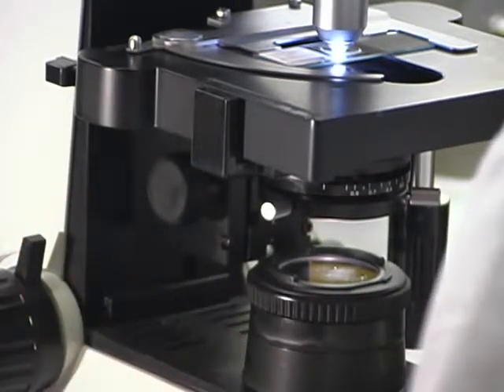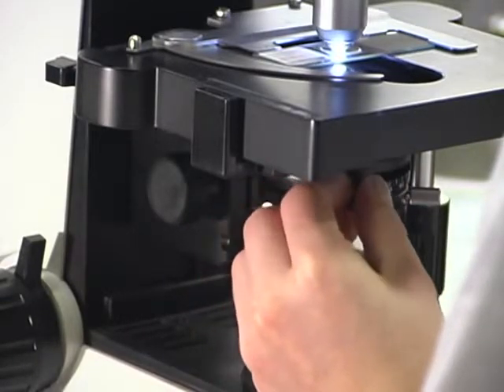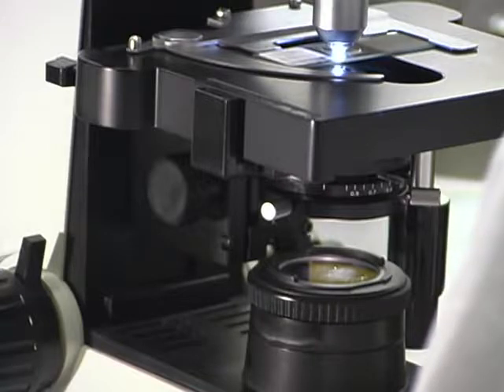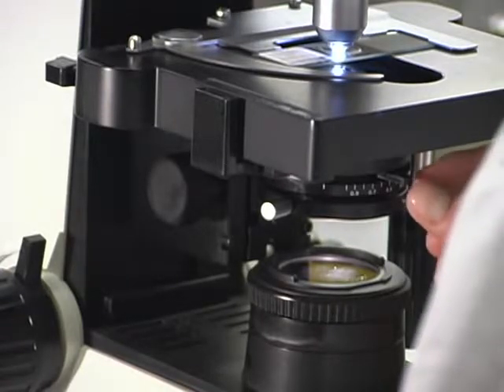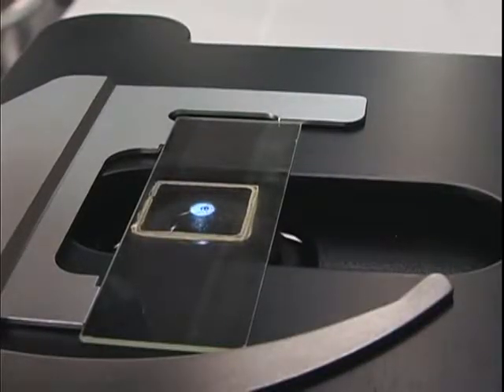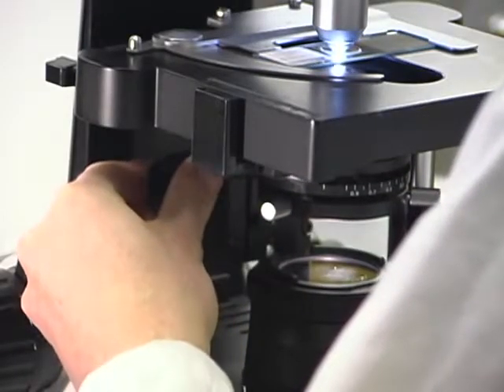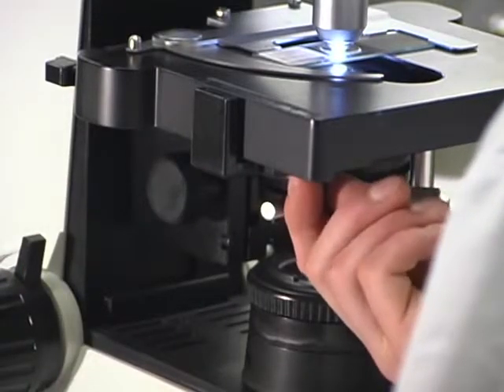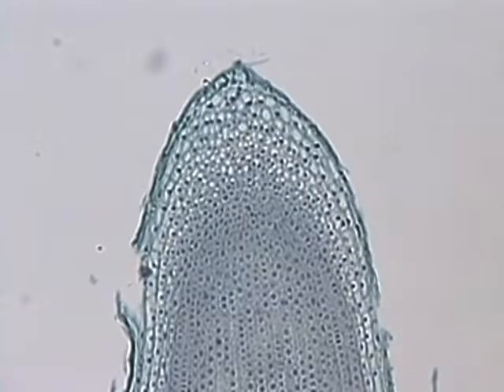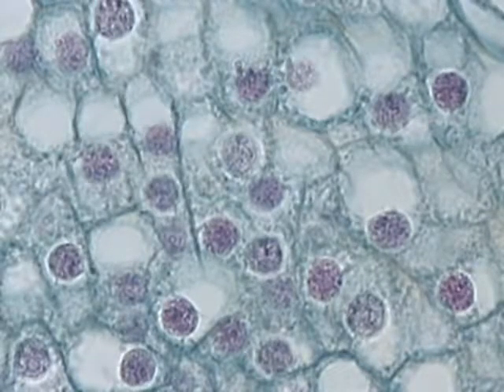As previously stated, the iris diaphragm on the condenser is used to adjust the width of the beam of light entering the condenser. Closing the diaphragm increases contrast and depth of field. However, if the iris diaphragm is open too little, there will not be enough light to see the object clearly. If it is open too much, the extra light causes glare. Move the condenser down until you get the best view of the object. With experience, you'll learn what are the best positions of the condenser and its iris diaphragm for your particular microscope and its magnifications. After adjusting the lamp and condenser for the lowest magnification, there should be little need for adjustments at higher magnifications unless you change the microscopic slide.